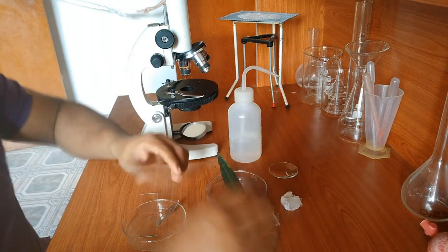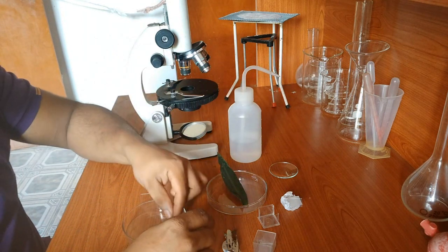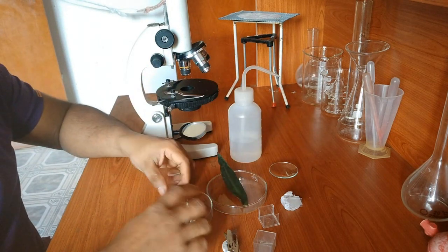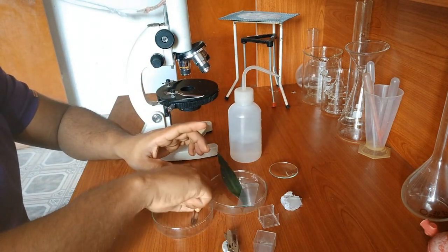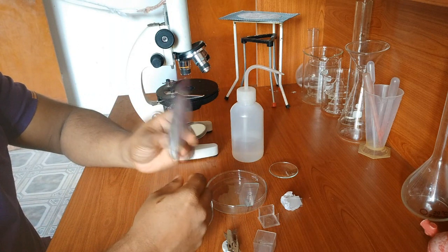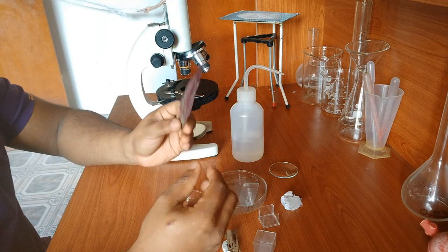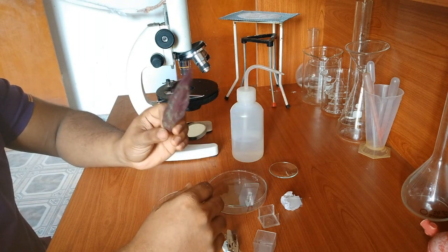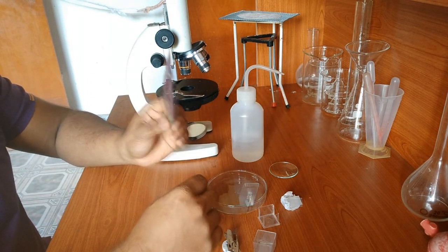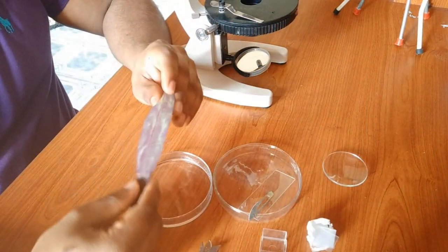And we need a sharp blade. Here you can see the sharp blade, a surgical blade I use here. And we need a slide, a clean glass slide. You can see that, right? We need a petri dish and we need water in that, because these plant cells, if you keep those plant specimen, the tissue what we taken from this in a dry area, what will happen, the cells start to shrink and the cells start to die. So we need to see healthy cells. So ultimately after you take the specimen, what you're going to do, we are going to put those samples onto the water. Right. Now we are going to take a thin specimen in this leaf.